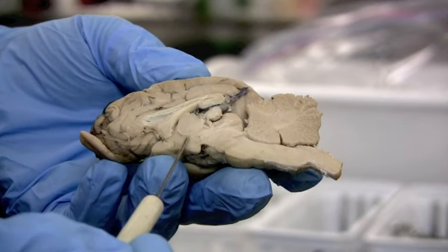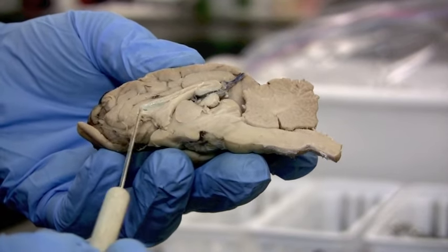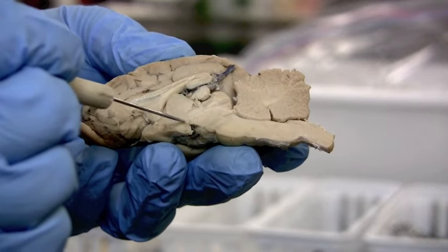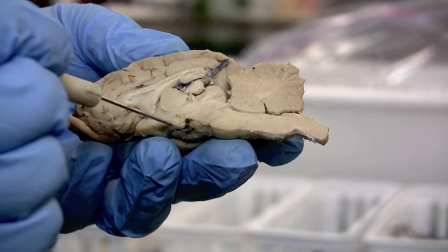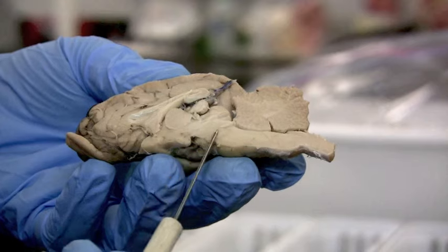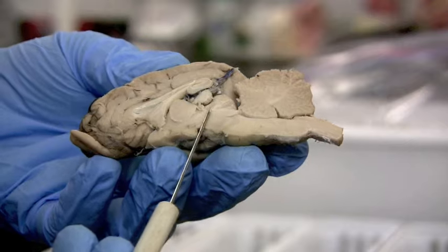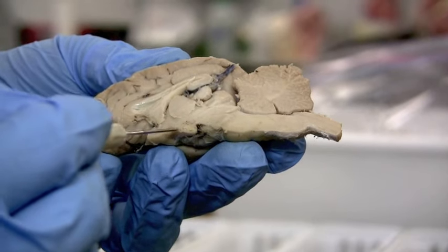If this round circle is the thalamus, then below it is the hypothalamus. This region between the mammillary body — this round structure — is the mammillary body. And these are the cerebral peduncles, the footpaths that we've cut through coming from the pons. They're right on the other side of the colliculi. These are the cerebral peduncles. Mammillary body. And then the hypothalamus.